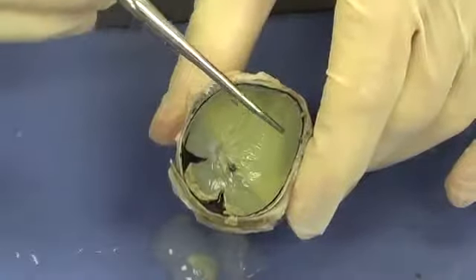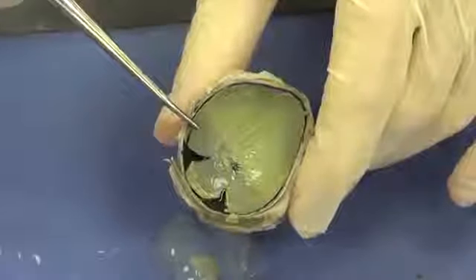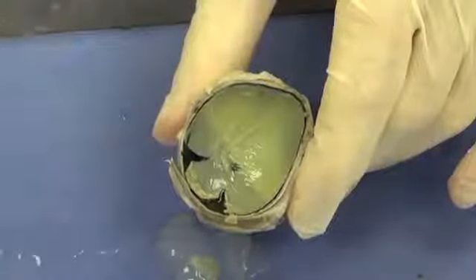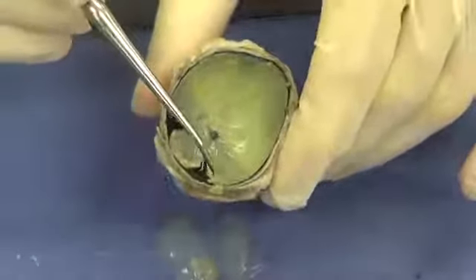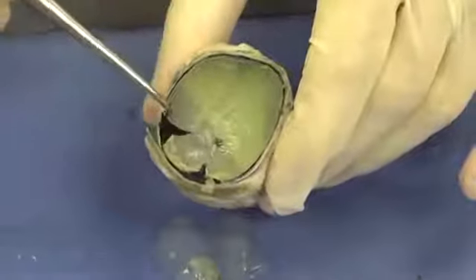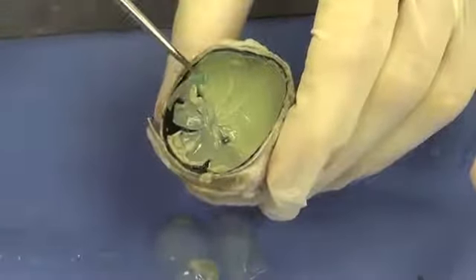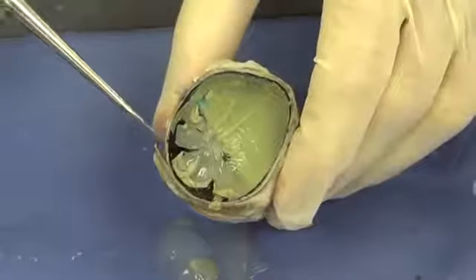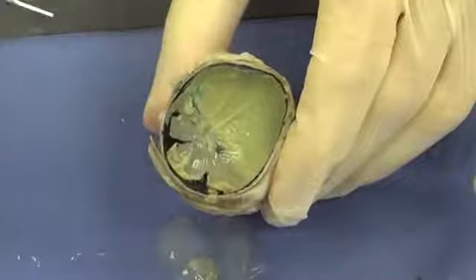This material is probably the most important part of the eye as it contains all the photoreceptors, the light detectors that actually detect the incoming light. Now as I move this material, as I move the retina, you can see how I'm bunching it up and moving it. It's actually going to be stuck to the eye at a certain point, right here. We'll see this in just a minute.